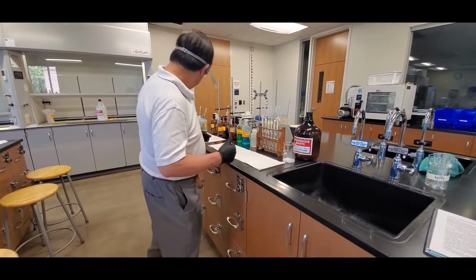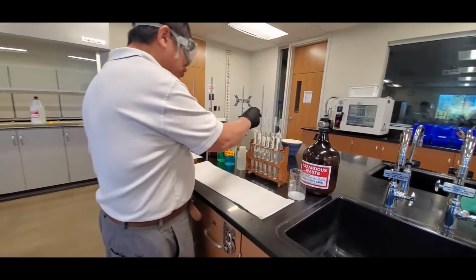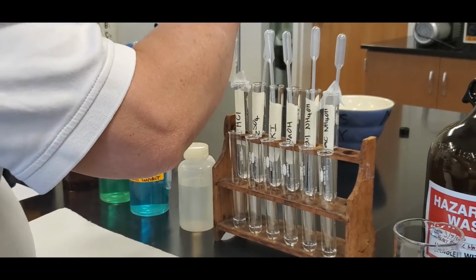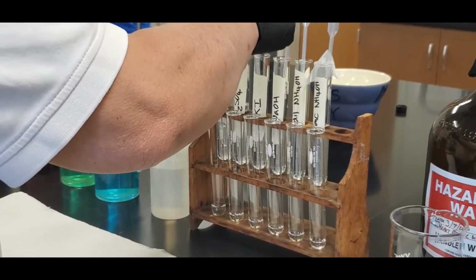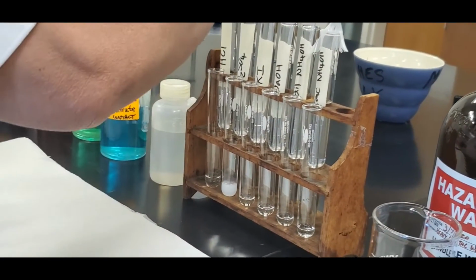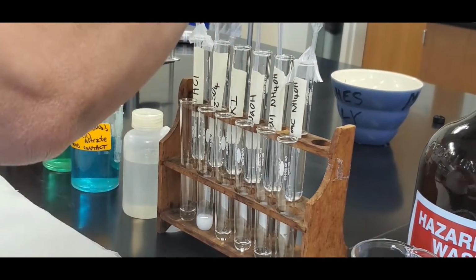All right, class. Next one. We're going to do this in sequence. The next one is strontium. Here we go. Hydrochloric acid. Sulfuric acid. Oh, this one's not. Ooh, there it is. I thought it was a screw up. Potassium iodide.